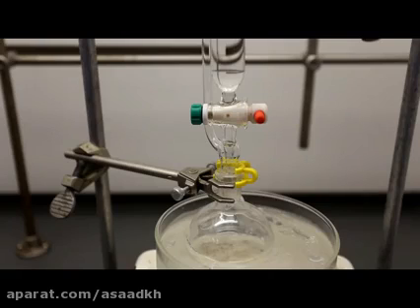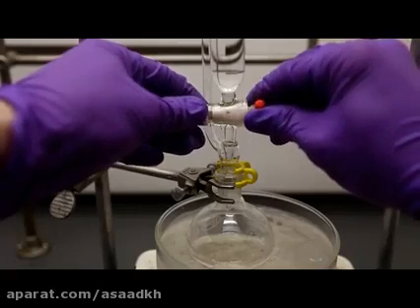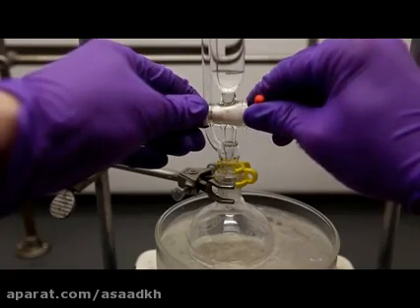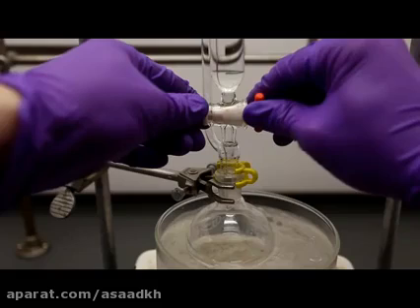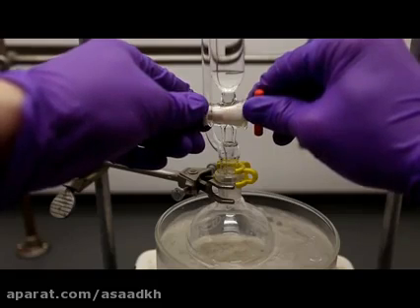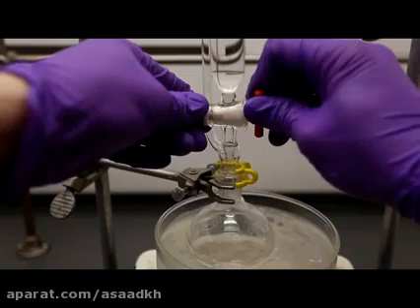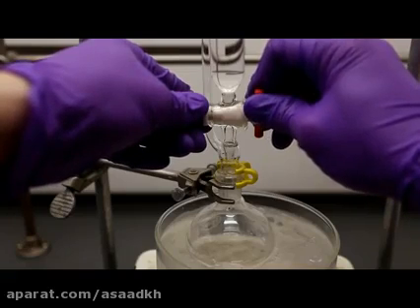This reaction is extremely exothermic, and adding too much 1-pentanol can cause the reaction to run away and effectively ruin our reaction. If you make sure that the reaction is strongly stirred, that the 1-pentanol is added slowly, and that the ice bath is constantly replenished, then this reaction should run well. Adding it slowly does take a while, so be patient.